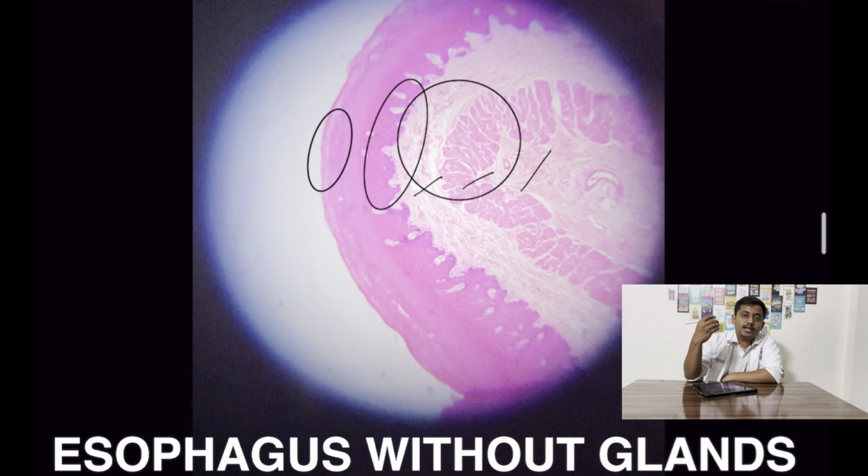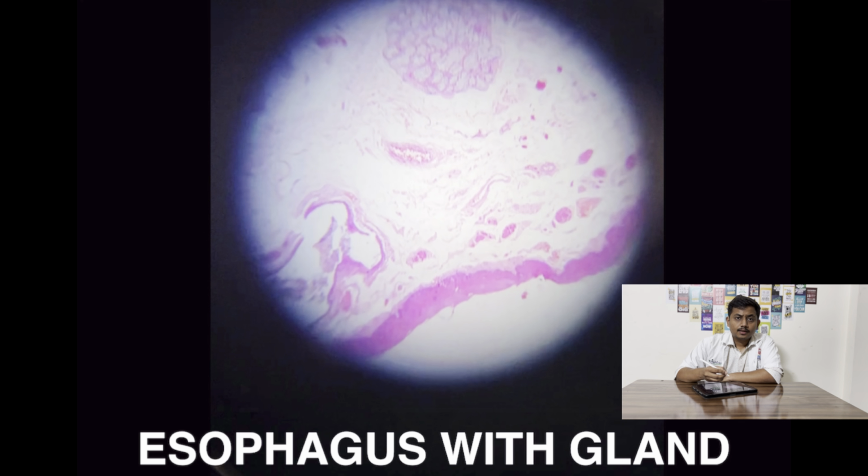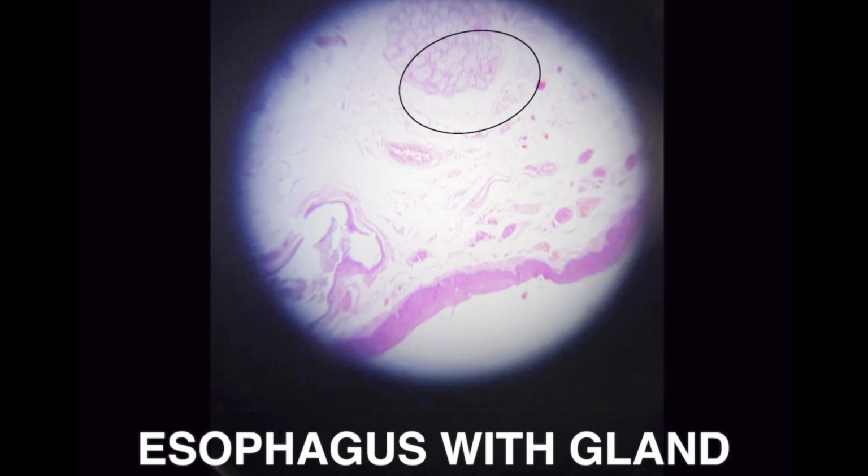The adventitia layer is present near the trachea and the serosa layer at the lower end of the esophagus. In this slide, you can note the presence of glands in the submucosal layer. These are the glands which are present in the lower part of the esophagus and can be used as an identifying feature for the tissue with glands.